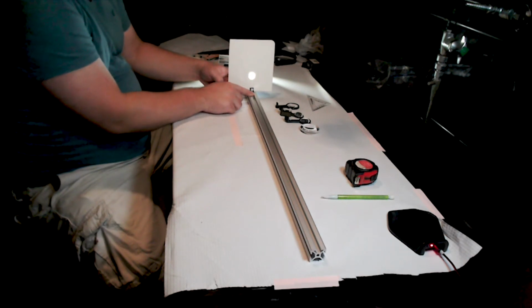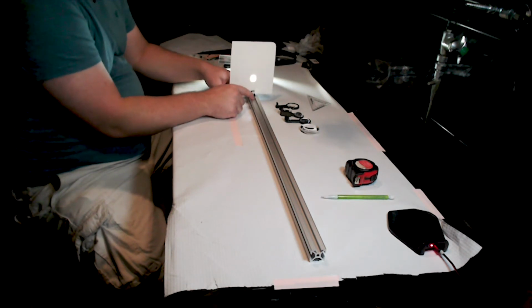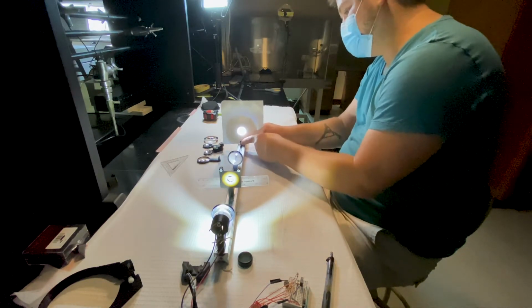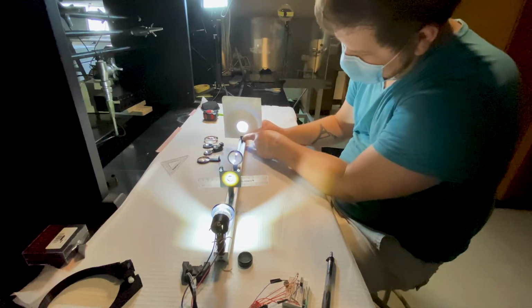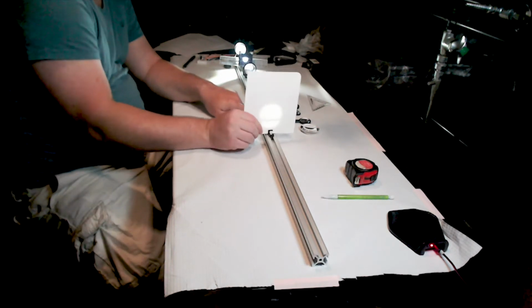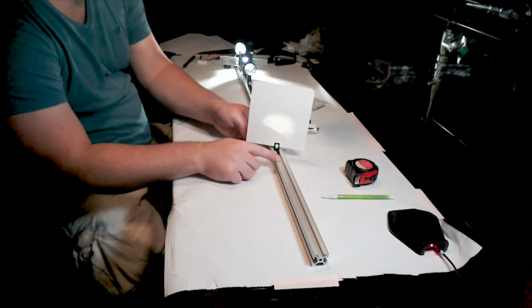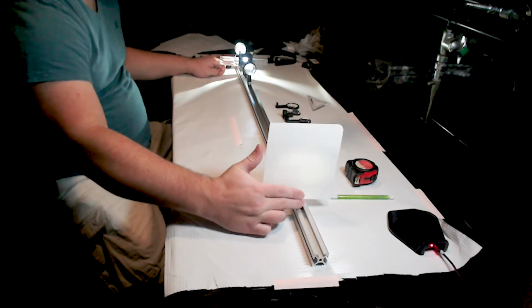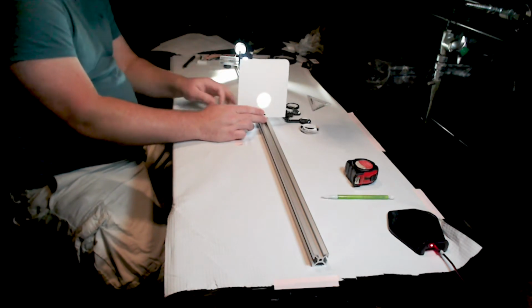And then as we bring this guy closer and closer to the focal plane, what you see is a gradual sharpening of the image until it gets to its sharpest, right about there or so. And then it continues to diverge until it's effectively just blurry and not very useful to us. That's what the light looks like as it comes out of that lens.